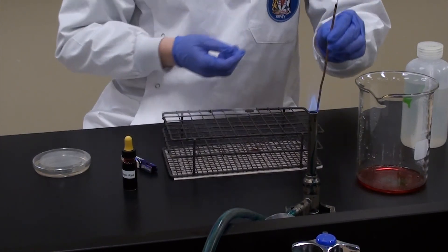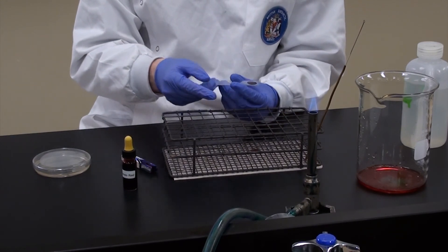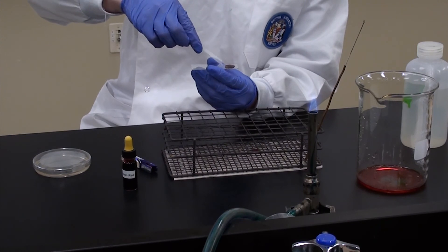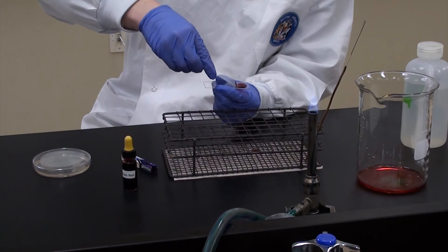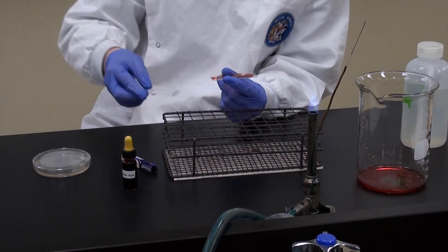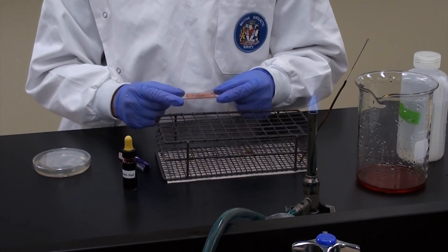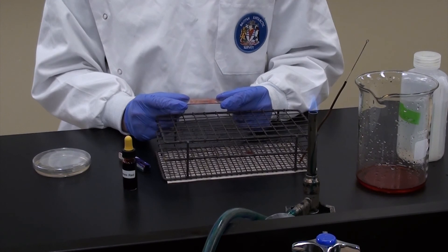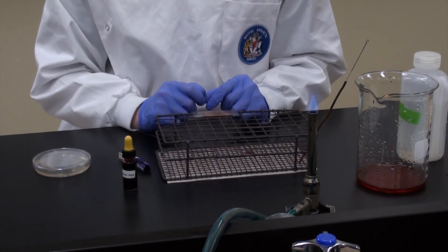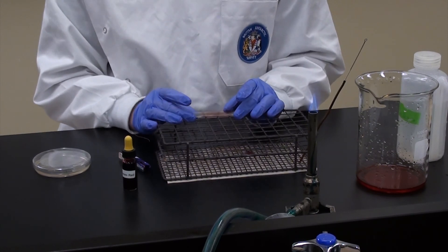With that, put your loop off to the side and you're ready for the next part — this is where things get a little tricky. What you're going to do is angle your slide at a 45-degree angle, back it up to the dye on the second slide. Once the dye has moved across the base of your second slide, drag it across the first slide — you should then have a lovely streak. Once your slide is dried it turns a little crusty and nothing comes off when you shake it gently, meaning you're ready to visualize. It's very important that you don't heat fix your slide during this process, because you may destroy the bacterial cell — the whole point of a negative stain is to visualize the morphology, and if you destroy the cell, there is no morphology.